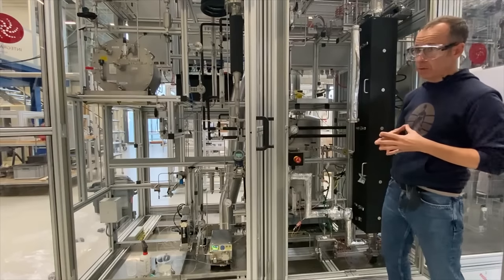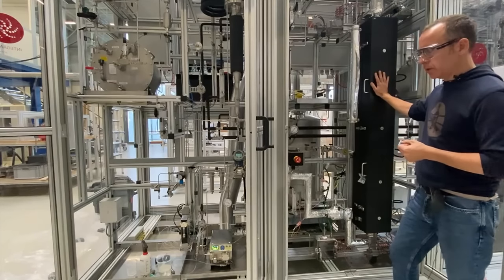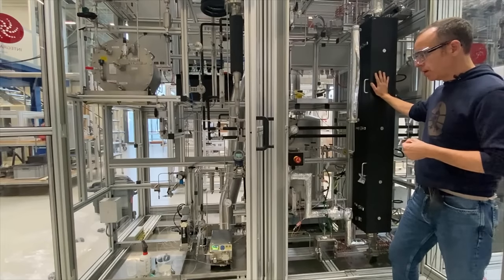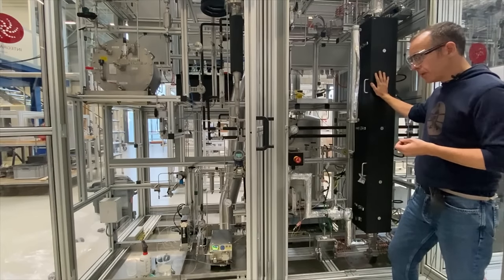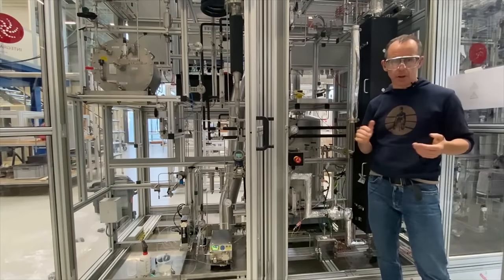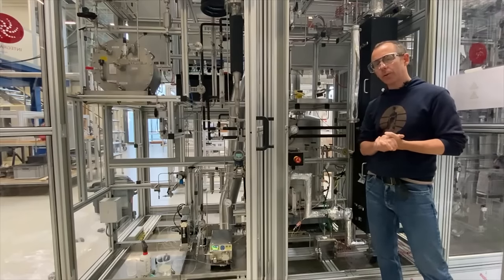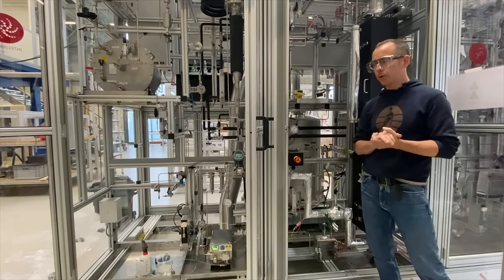One of the particularly challenging things when doing CCR is having the ability to do so-called ISO RON reforming testing. That means measuring the product concentration continuously online and slowly tweaking the temperature of the reactor itself — which is actually how it's done in the plant. So as you slowly get deactivation over time, you then slowly increase the reactor temperature in very small increments. That is one possibility we can do here at ILS.